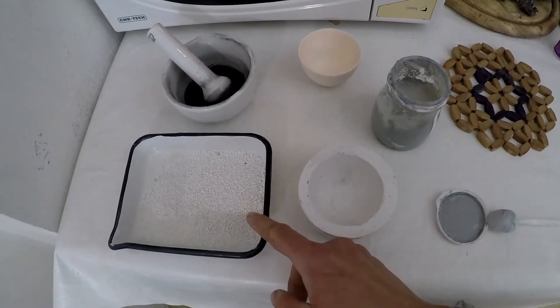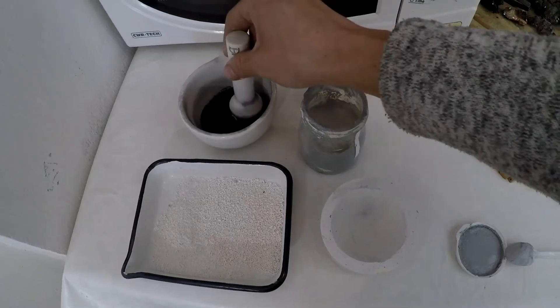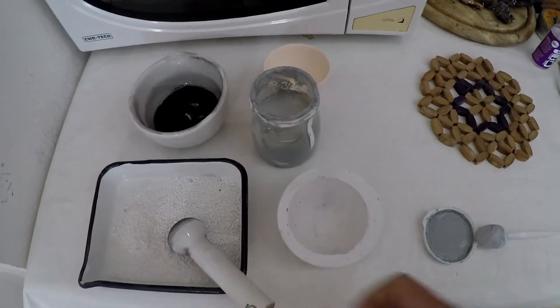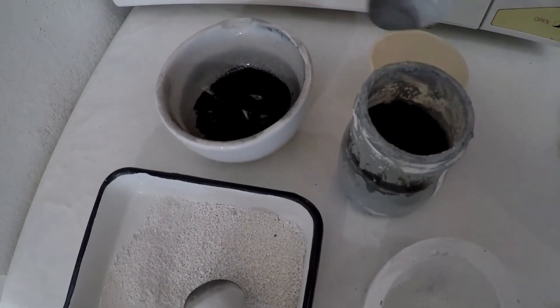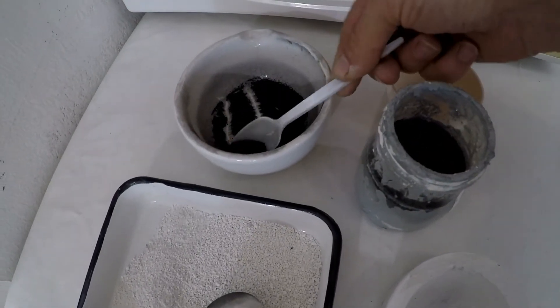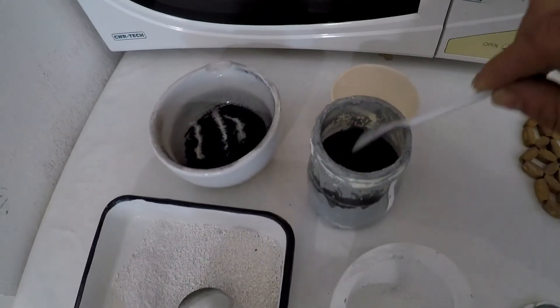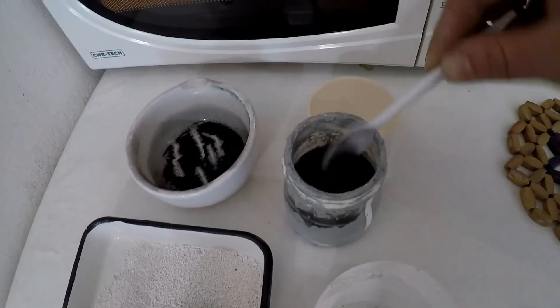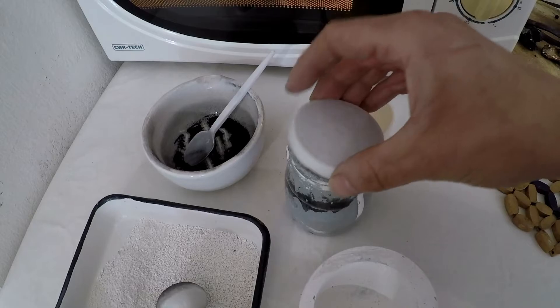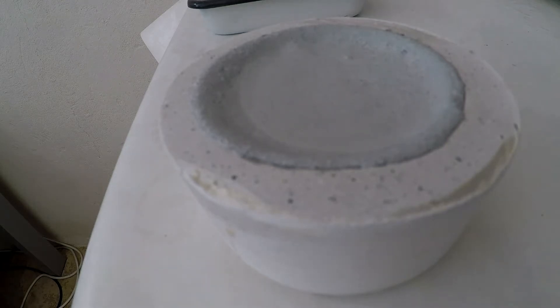Inside I have grogged alumina pieces and some charcoal dust powder which I've ground up using a mortar and pestle. After some research on particle void formers, it appears that sawdust and charcoal dust can be used to create voids, because during the burnout process the particles suspended in the slip will sublimate leaving a perfect void.